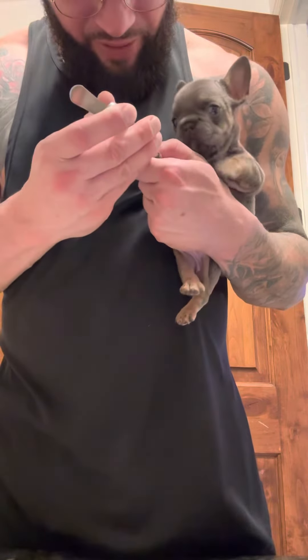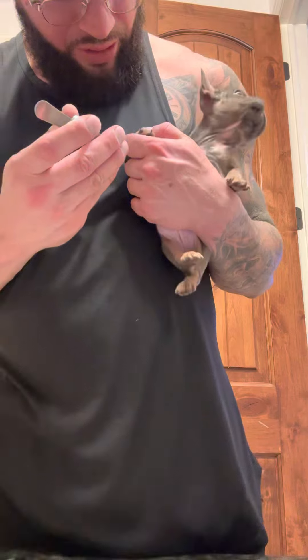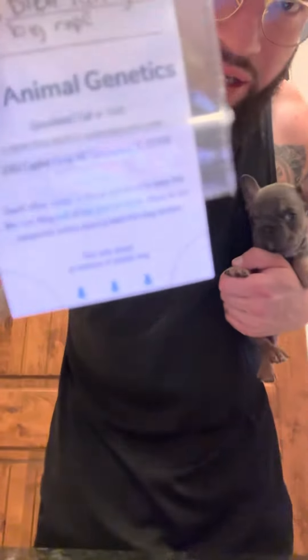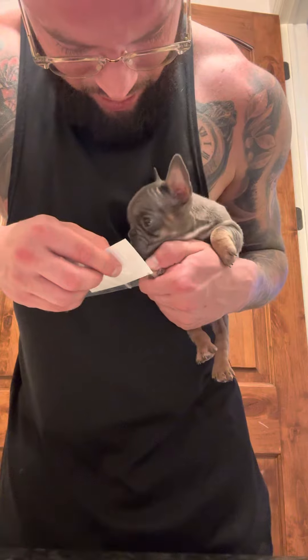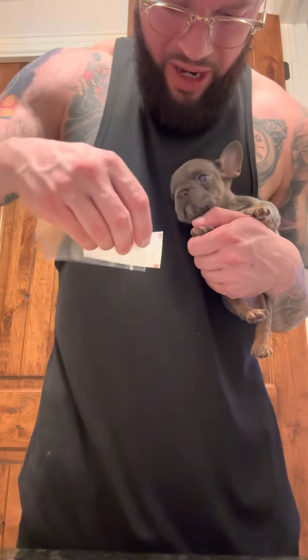I've cut them and there's no blood so far — that should do the trick. I've got my DNA card right here, already labeled. You see these little corners at the bottom? That's where the blood is going to go. You get the nail a little bit short, get the blood on here just like that, and make sure you get it on both sides.